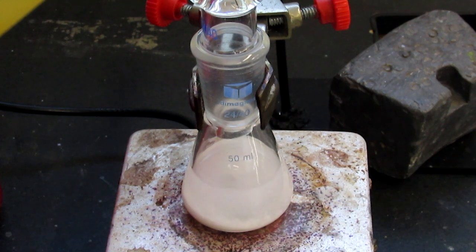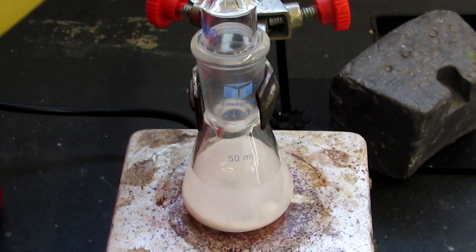I've added the triphenylphosphine to a jointed Erlenmeyer with the 30 mL of isopropanol, and I've now set that up for reflux with stirring. We're going to heat it up and reflux it till it all dissolves.